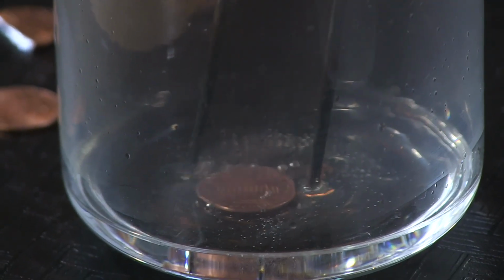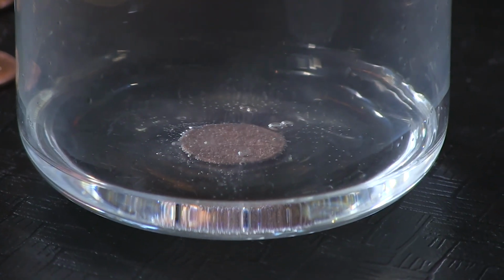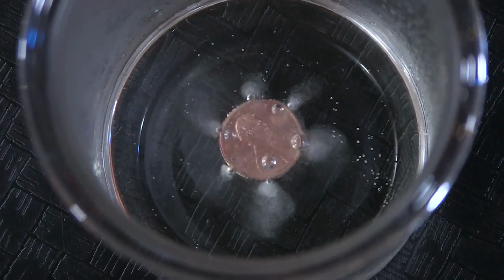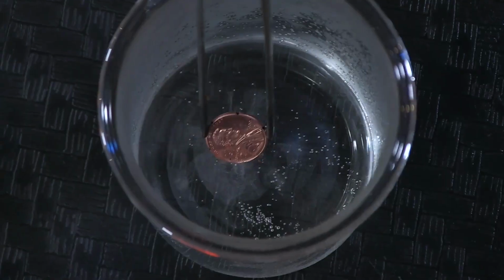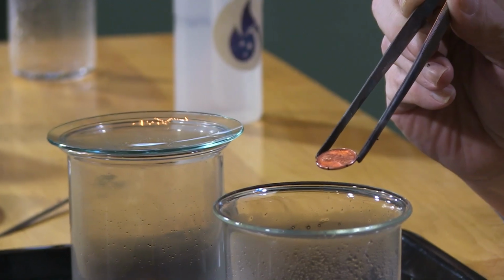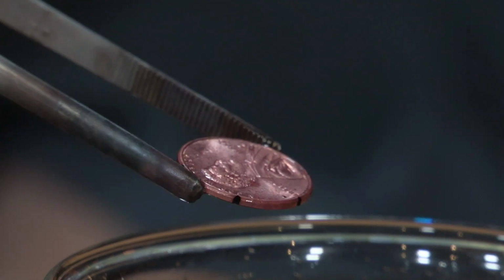And I'm not gonna drop it in the acid. I'm just going to hold it right over the acid. Just let it fall maybe an eighth of an inch. I don't wanna splash everything there. And there it is. Look at this. Those six little holes on the edge of the coin, there are bubbles coming out. The acid is reacting with the zinc before it reacts with the copper. It's more chemically active. And eventually, all the zinc will be gone and I'll have a hollow penny. If you look down in that little black crevice, it used to be shiny and something, it's disappeared, there's a hole. It's been eaten out like termites or something.